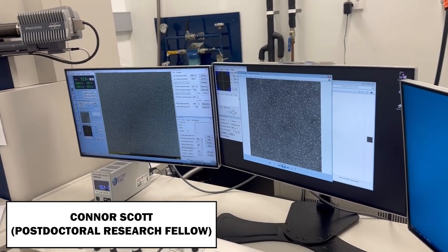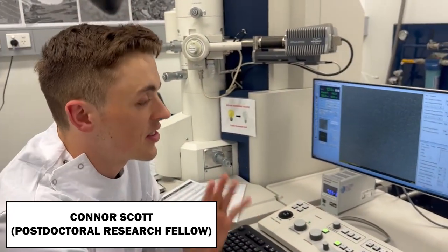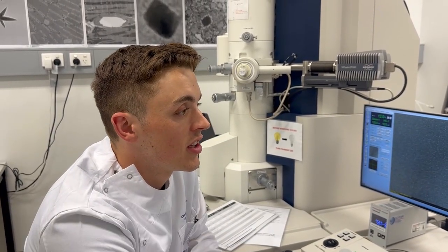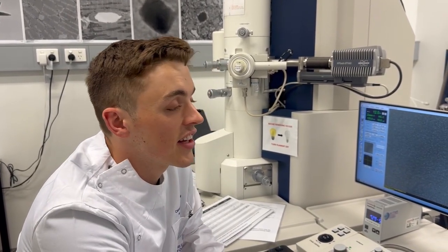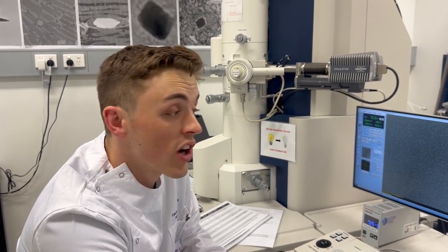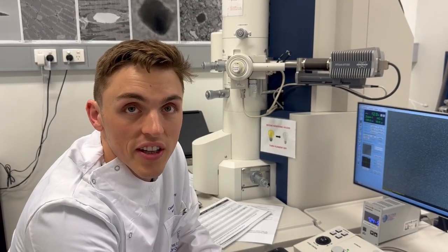It's sort of hard to make an on-the-spot decision based off just a few images. So best practice is to collect a data set and then process it using a software called CryoSPARC, and basically from that you can generate those 2D classes.